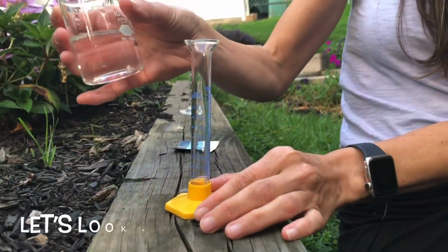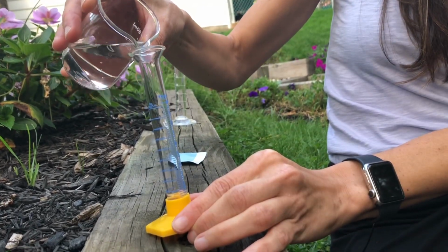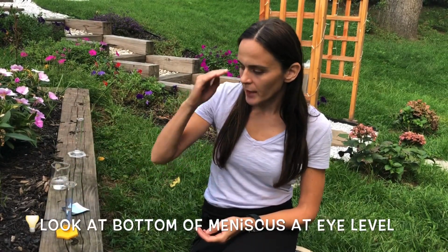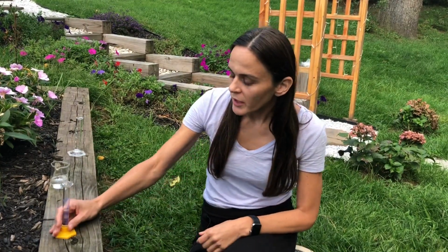I'm using a small beaker, and I have water in my beaker, and I'm going to add some water to the graduated cylinder. To obtain the volume of the water in a graduated cylinder, you want to look at the bottom of the meniscus at eye level. You never want to look down like this. You want to actually lean in.